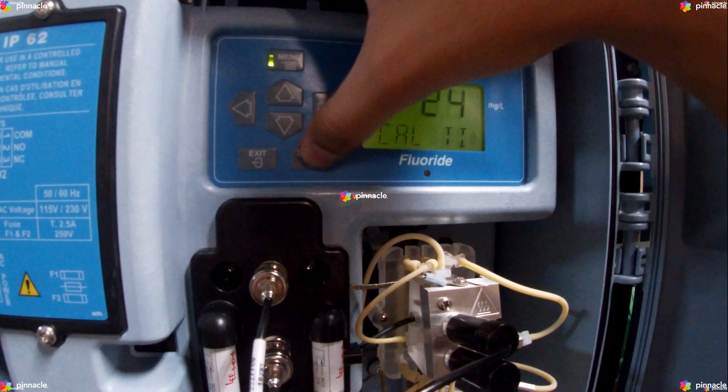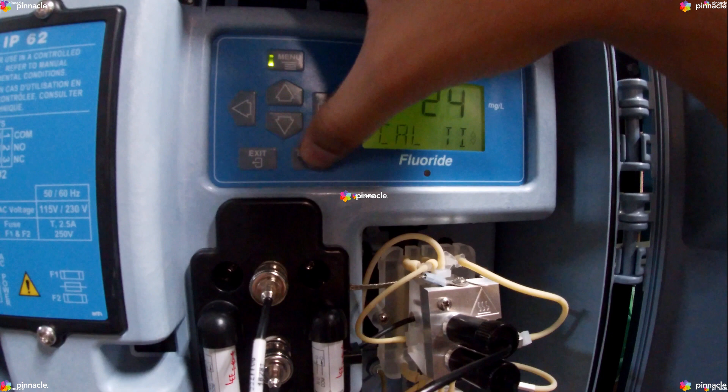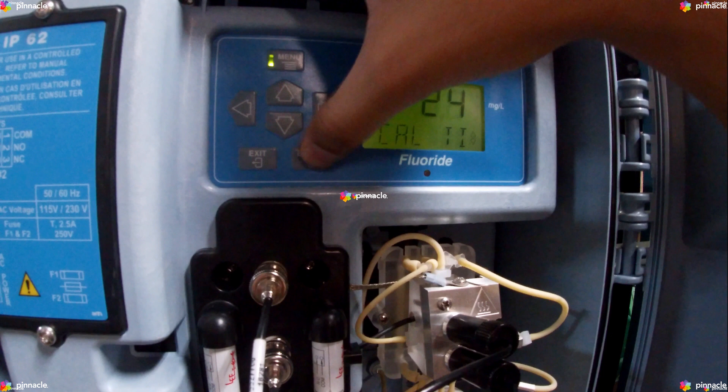The Standard1 option sets the value if a different standard is selected for special sampling circumstances. The Standard2 option sets the value if a different standard is selected for special sampling circumstances as well.